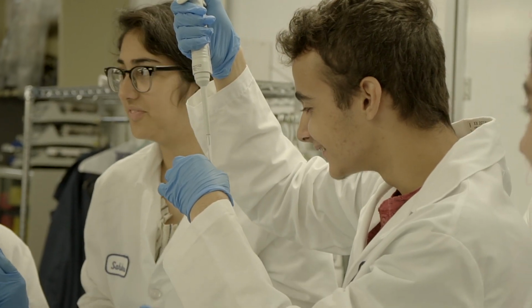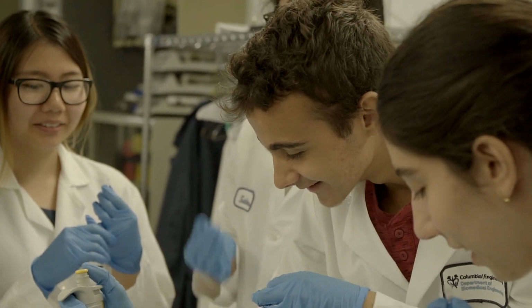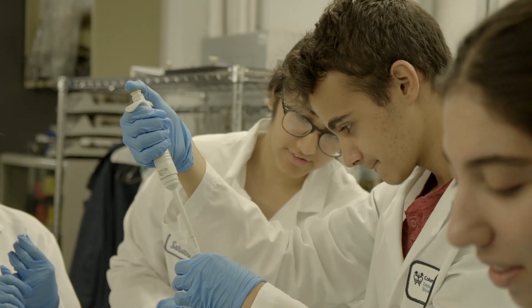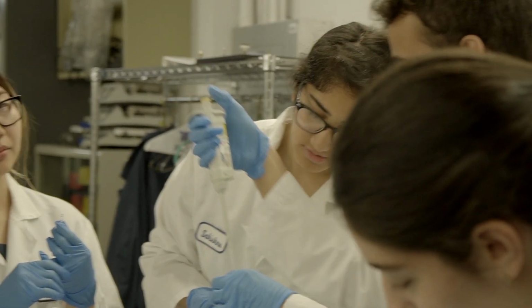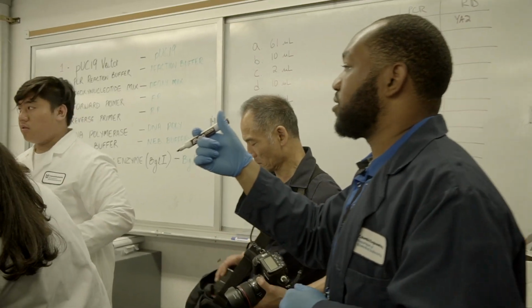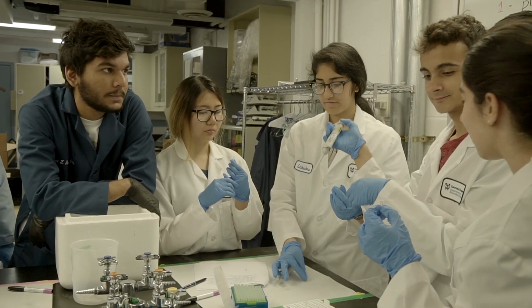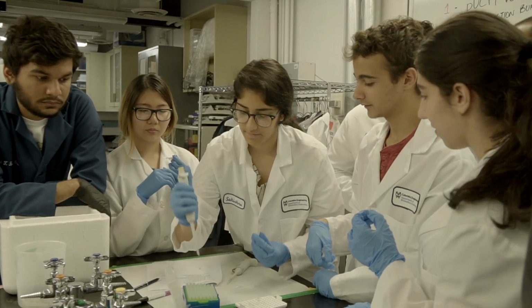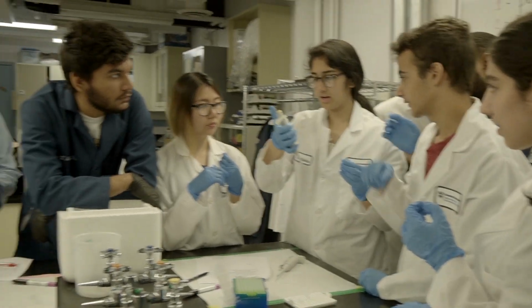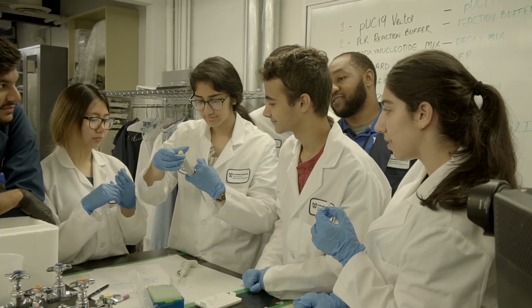Wait, nothing's going in. That's better. Okay, wait, I'm pressing it now. Has everyone else done the template? Please don't do it so fast. Once you get to one stop, go in, slowly come up. Very slowly. Okay, wait, you try. And there's liquid in the tube, right? Yeah, there is. What is it set to? That's not 10.